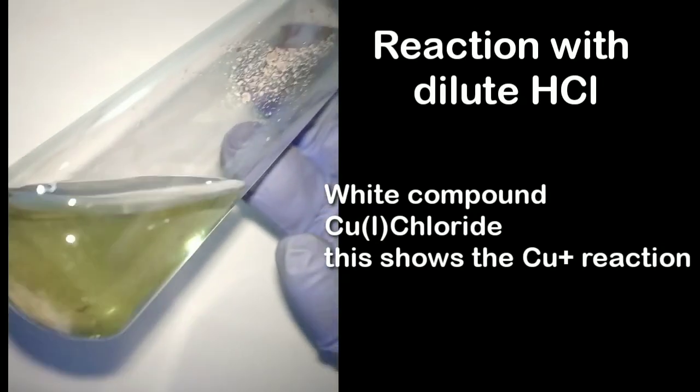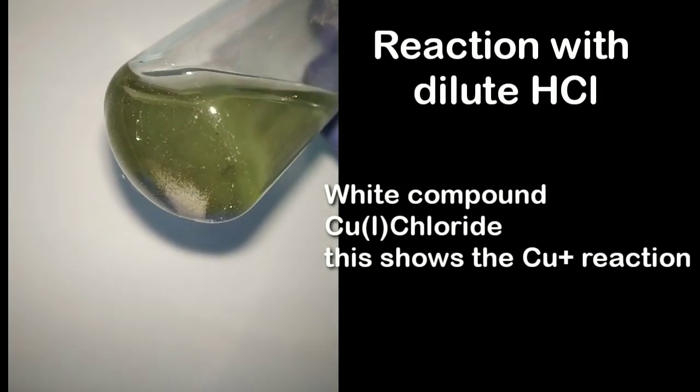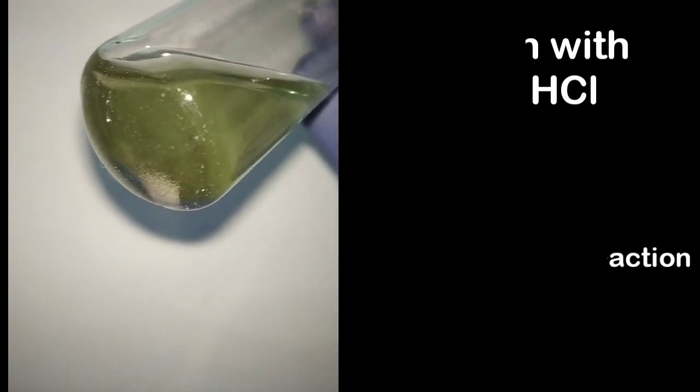Also, if we use increased amount of the acid, the precipitate will get dissolved in it.